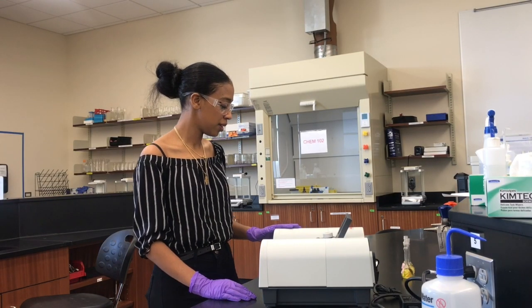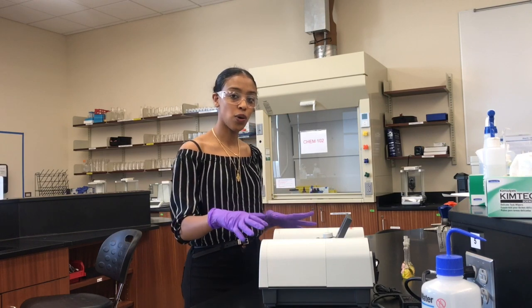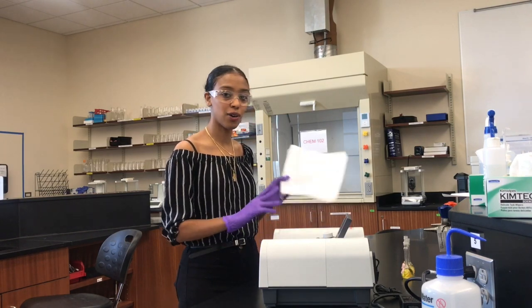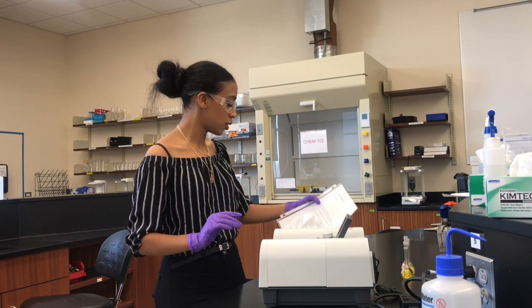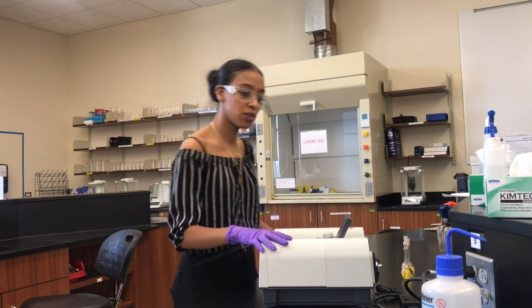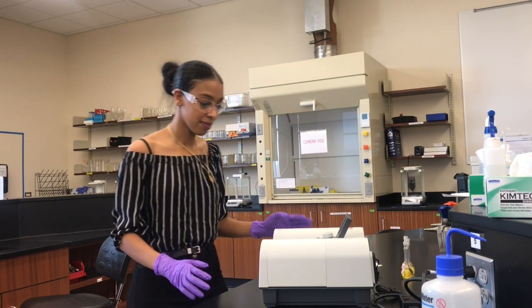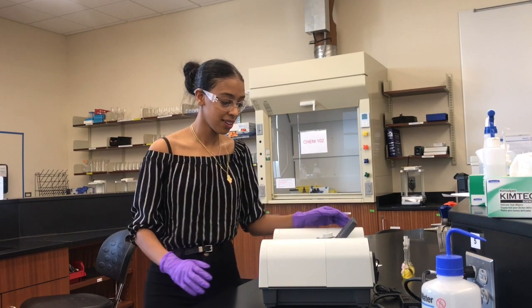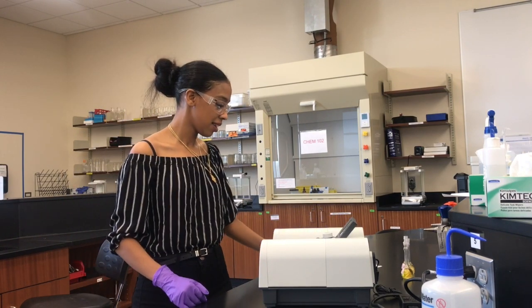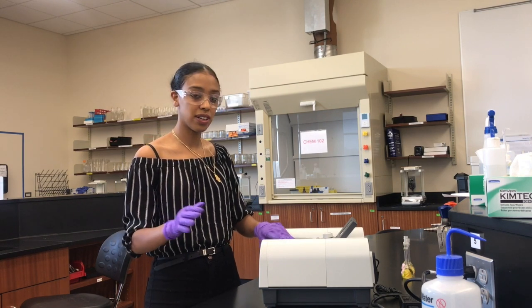Hi everyone, in today's video we will be learning the use of a spectrophotometer in chemical analysis, and we will generate a standard curve using our standard solution of tartrazine that is used to determine the concentration value of an unknown. To do this, we will be using the SPEC 200 spectrophotometer to measure the absorbance of the known and unknown solution. Using the data, we will then generate a calibration curve graph of absorbance versus concentration.